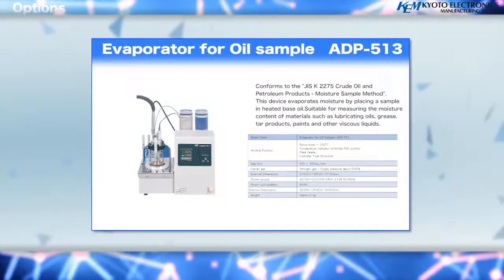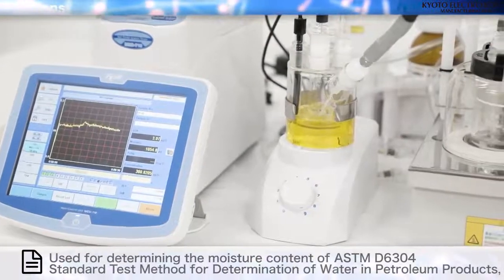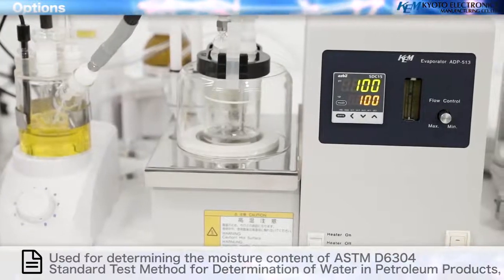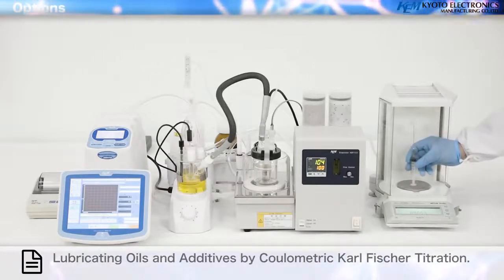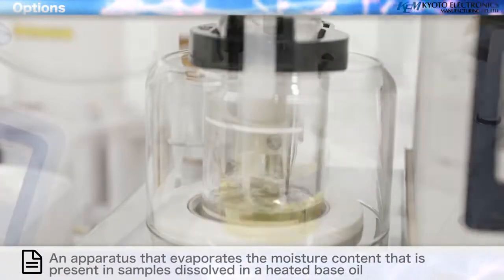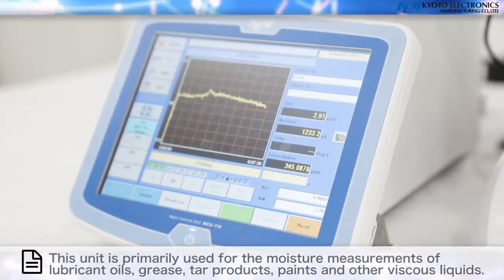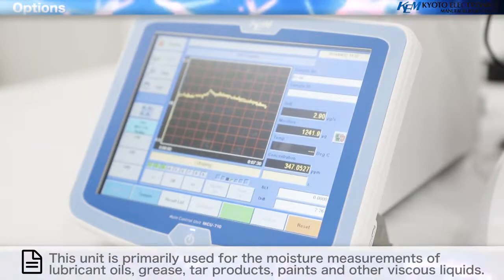Evaporator for oil sample, ADP 513, non-CE. Used for determining the moisture content of ASTM D6304, standard test method for determination of water in petroleum products, lubricating oils and additives by coulometric Karl Fischer titration. An apparatus that evaporates the moisture content present in samples dissolved in a heated base oil. This unit is primarily used for the moisture measurements of lubricant oils, grease, tar products, paints, and other viscous liquids.